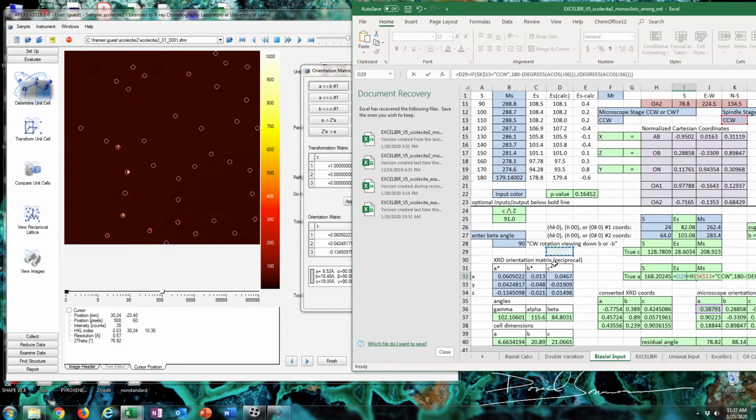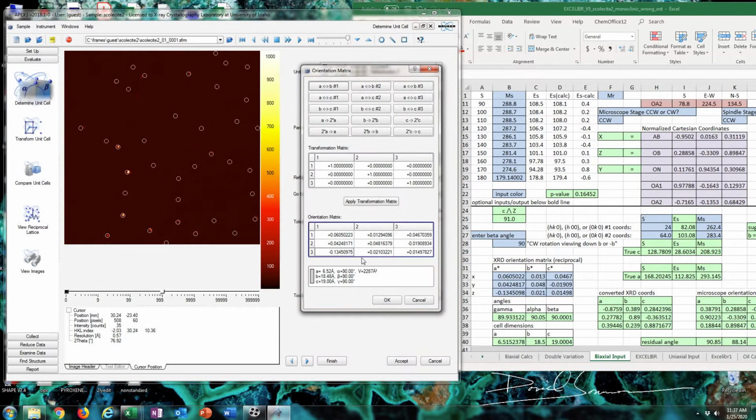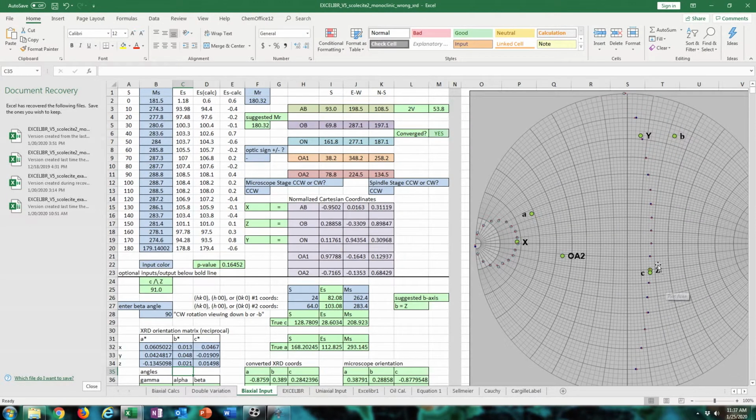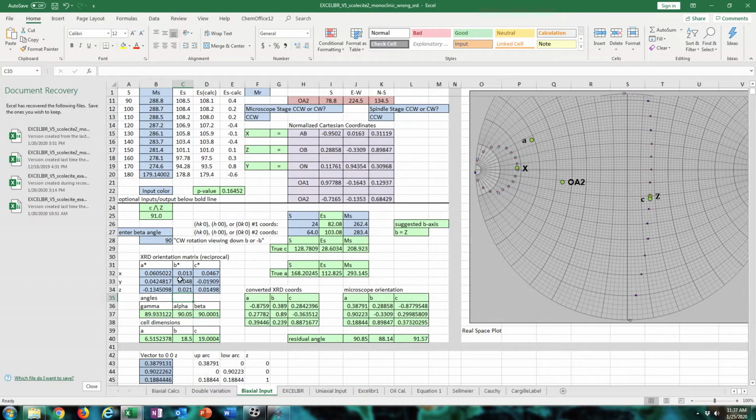ultimately I figured it out, and the beta angle that I have to enter here is around 71 degrees because it will only rotate clockwise, and that's the axis that works for the conventional setting for scolecite in monoclinic C. So here, yep, C is equal to Z, which means C is actually B. And A is truly A, actually. But the B axis here, which is supposed to actually be C, is not 90 degrees away, actually. So we have to figure that part out.